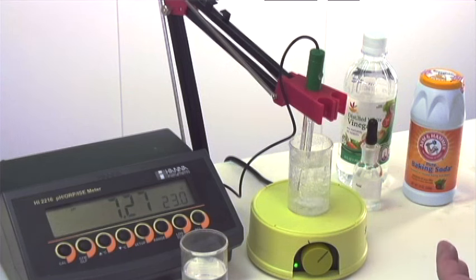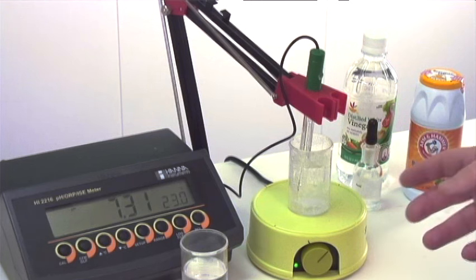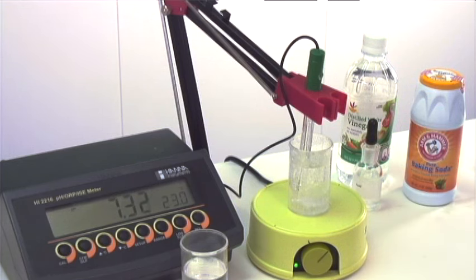When these two beakers started off close to the same pH unit, it took significantly more vinegar to change the pH at all with the baking soda as opposed to the deionized water.